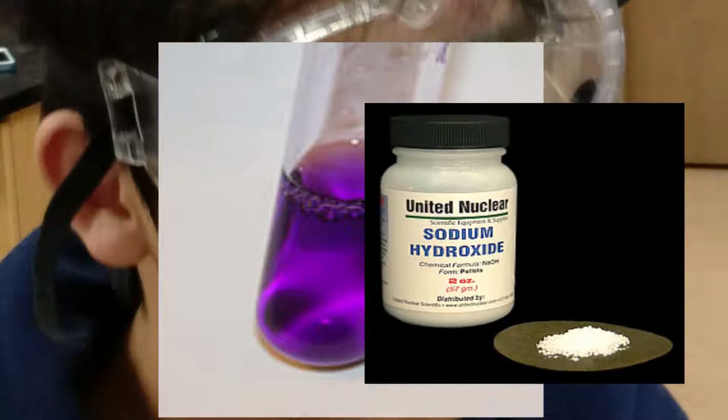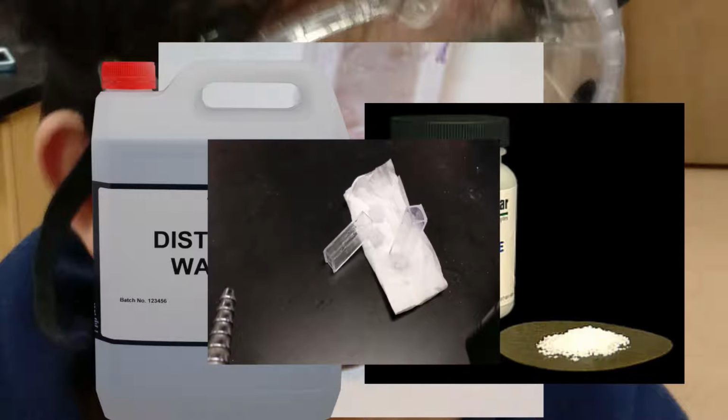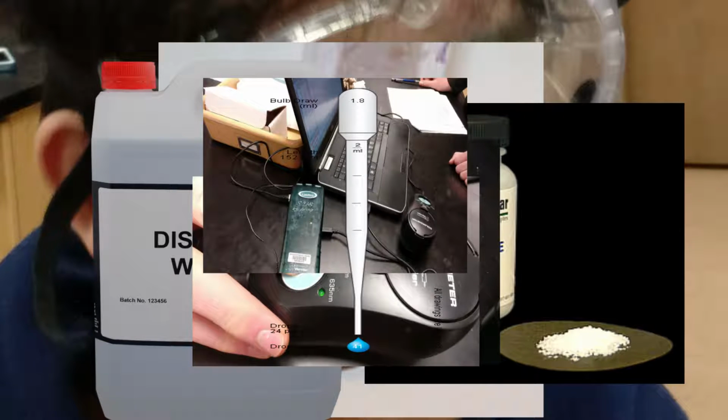In the lab, 25 micromolar crystal violet, 0.2 molar sodium hydroxide, distilled water, cuvettes, a colorimeter, a computer, 5 to 10 milliliter graduated pipettes, and a pipette bulb/pump were all used.